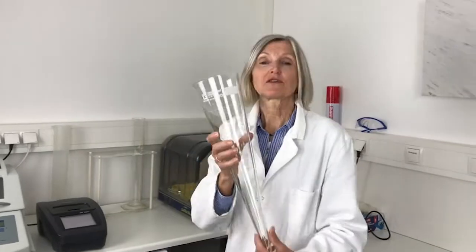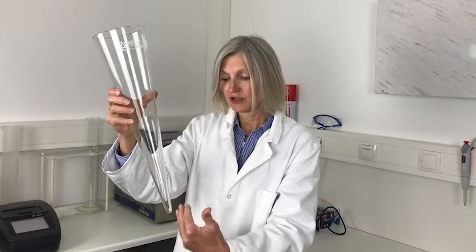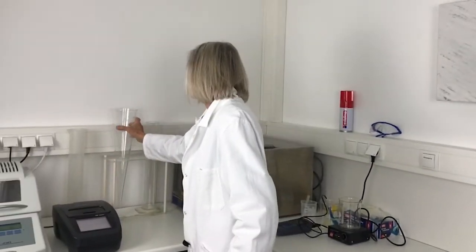This is the so-called Imhof-Trichter. We use it for the effluent of clean wastewater, and it gives us information about the settleable substances — that means the solids that are still in the wastewater after the treatment system. These should be very low, at least near zero.